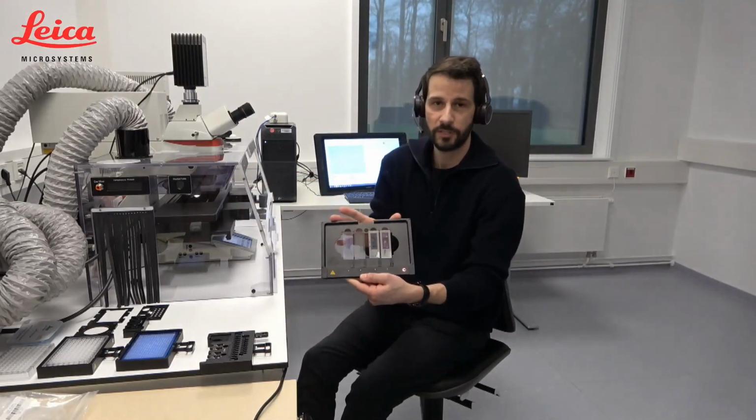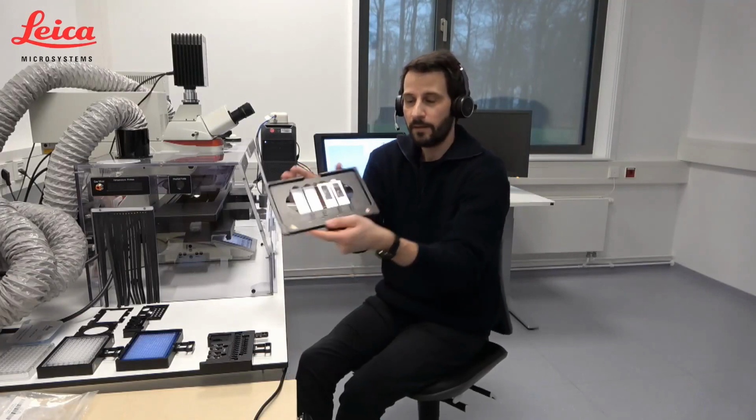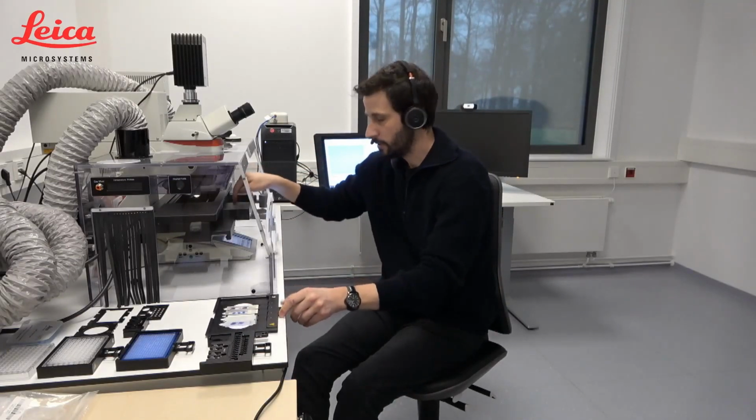But let's have a look at the system itself. The laser comes out of this box here into the light path of the system, and then you can see here the objective. And at the objective, it hits the specimen. And the specimen looks like this. In this case, we have 4 of them. I will tell you something about these later. On the specimen, the laser cuts, and then the dissectate drops down.